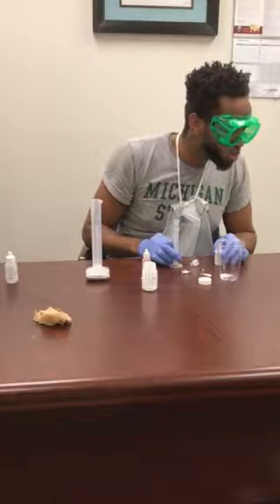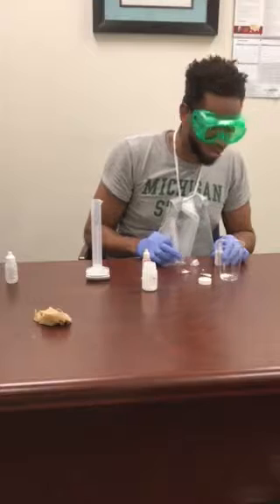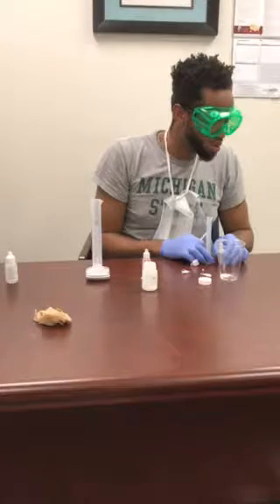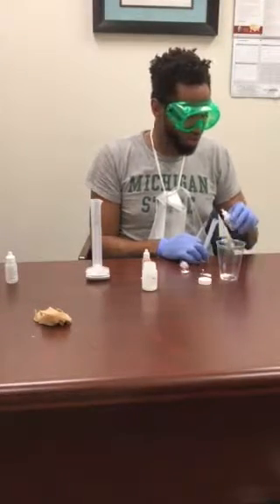Fill the syringe now. Do I put this in here?